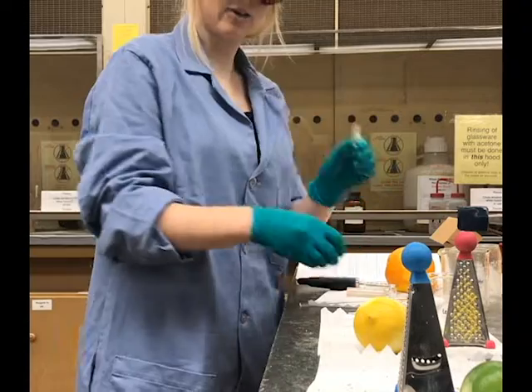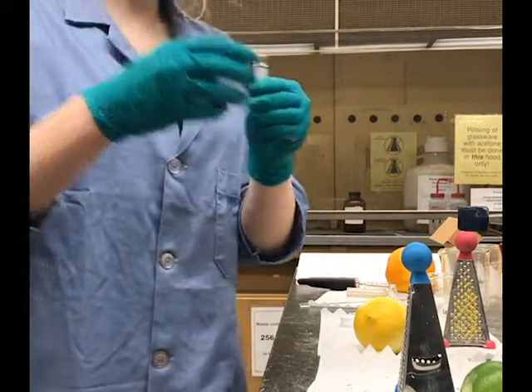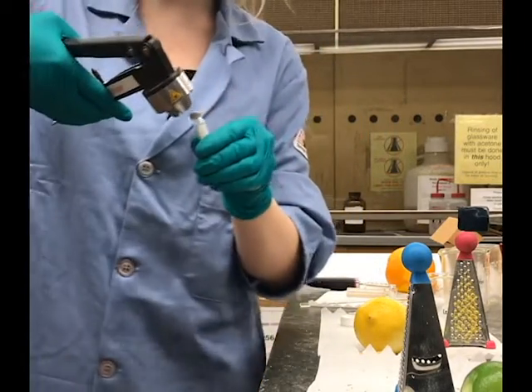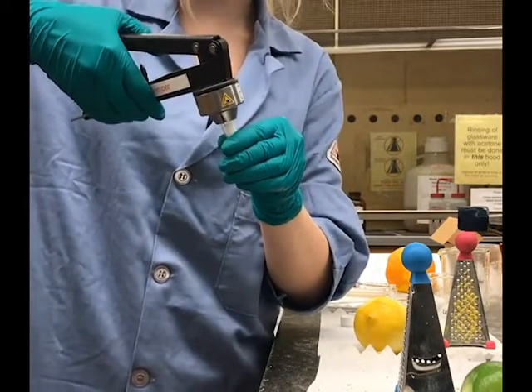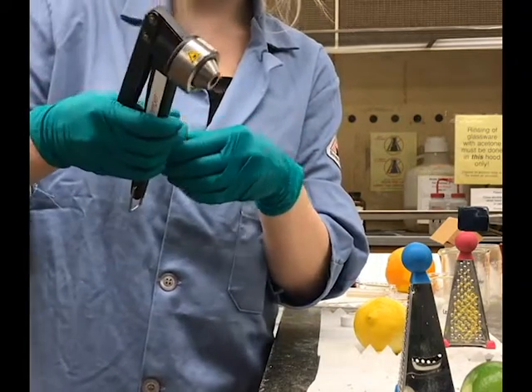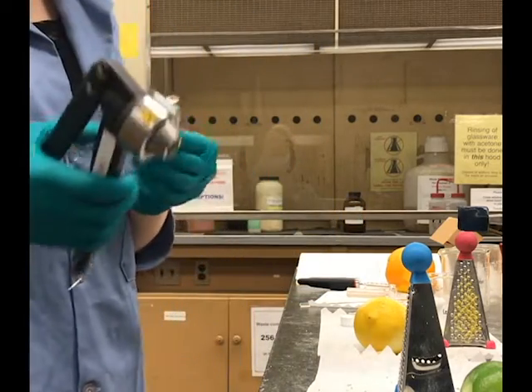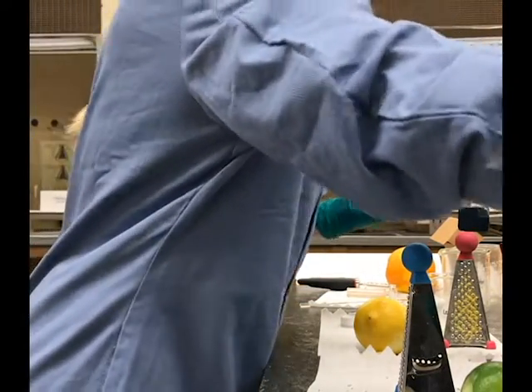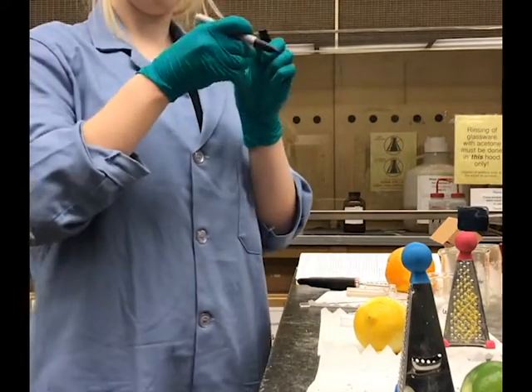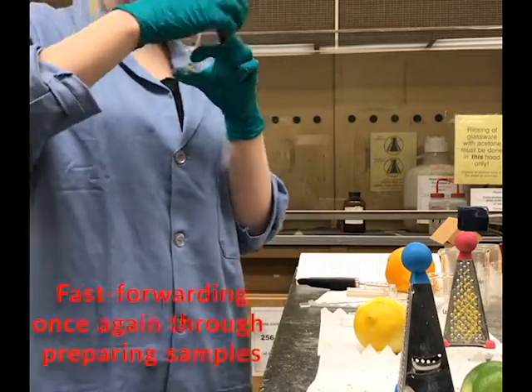Next, we need to actually seal these vials. So we'll place the lid on the top using the crimper, not for your hair, but for the vials. Bad joke, I know. You'll hear the crimp. And now it is sealed. We'll label it grapefruit. We'll put GR for grapefruit.